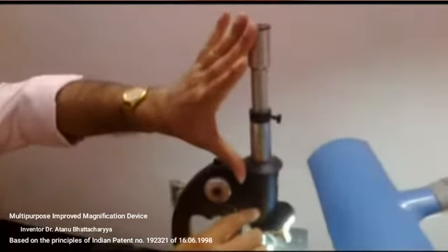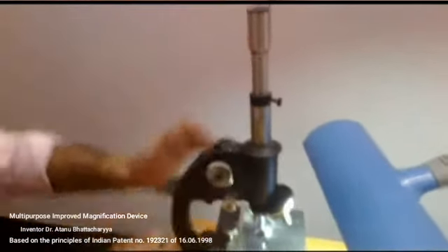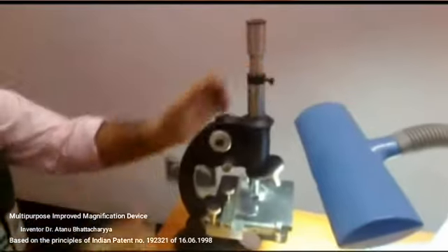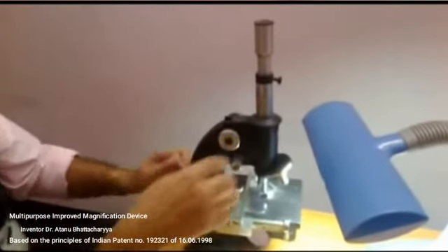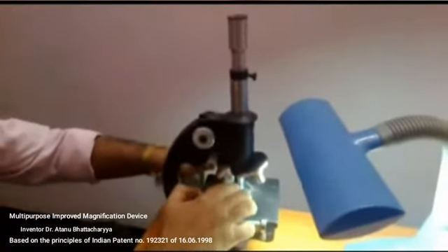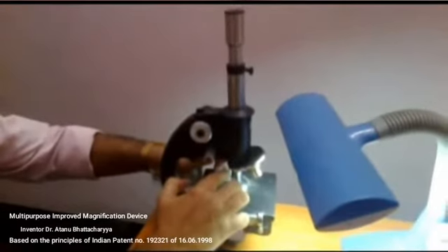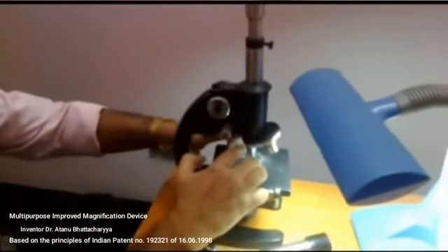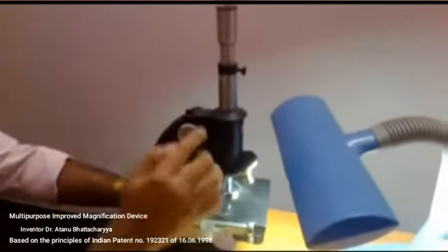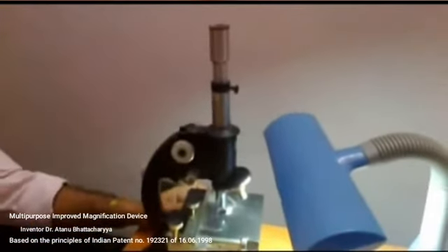It again magnifies it 40 times, but because this image is lowered here, this magnification is reduced here, so practically the total magnification is reduced much more. If I push it much more, then the magnification is reduced much more. Actually, at that time, sometimes it has been found that the image forms at a very lower position, so the object distance from the lens becomes higher than the image distance from the lens. That is why the magnification of the image becomes less than 1. So if it makes 0.8 times magnification, then it makes it 0.8 into 40, that means 32 times magnification.